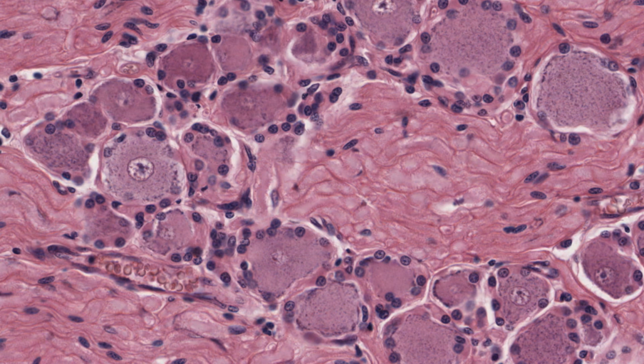Appreciate that the cell bodies of sensory neurons are the metabolic centres, maintaining the long processes of the sensory neurons. There are no synapses onto them. Therefore, the cell bodies can be closely packed together with little space between them, aside from the satellite cells.